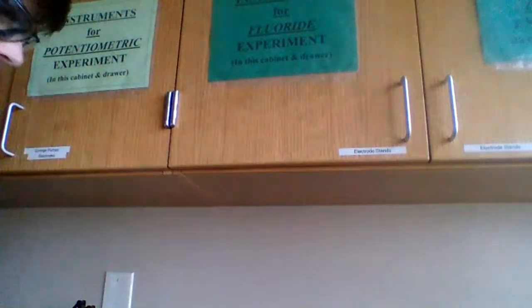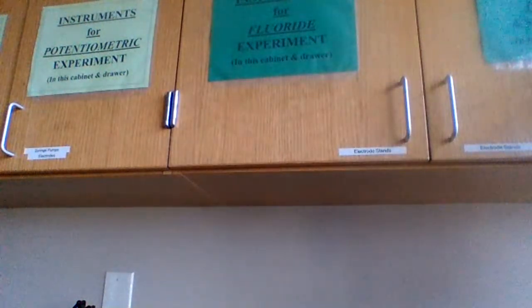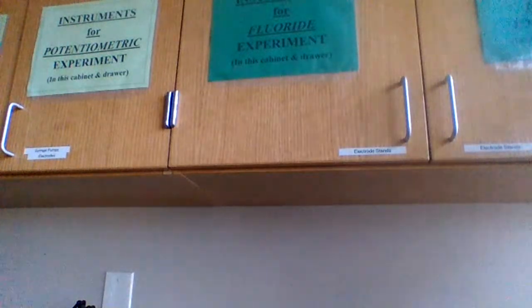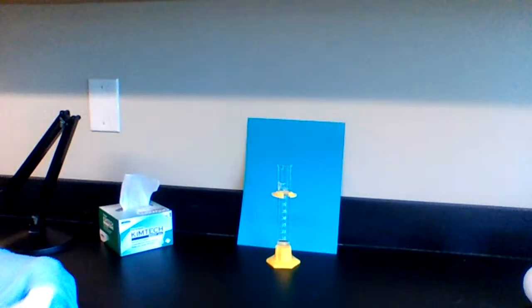We're guessing the 10th position of the decimal. And let's put our sample in the water to see how much of it gets displaced. So here's our trusty sample. Going to wipe it off a little bit.